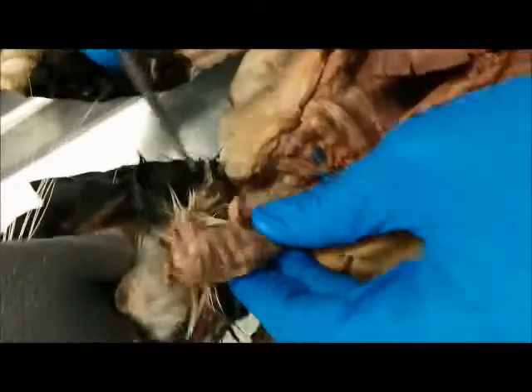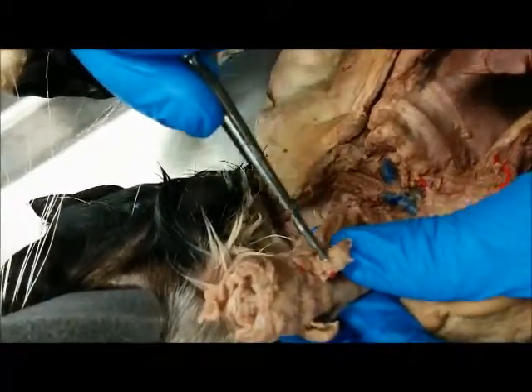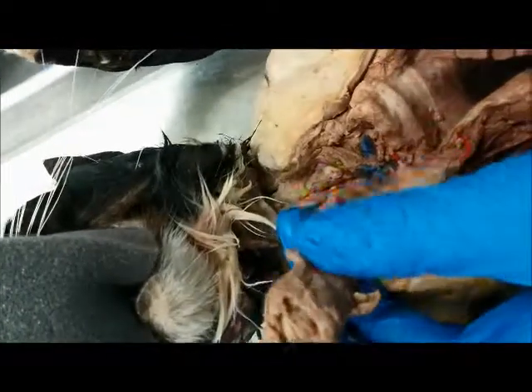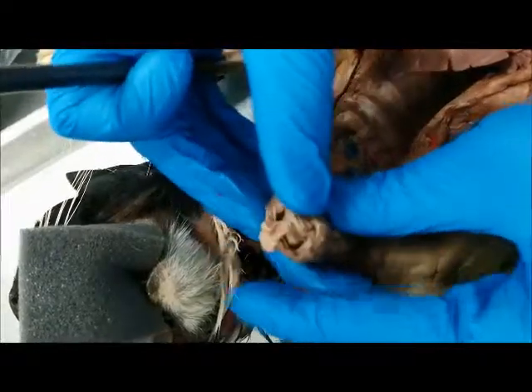And so now we're also going to take a look at the thyroid. So the thyroid, you have right here, you have one, and you have two. These little flaps right here represent the thyroids. And now let's actually take a look at where the trachea originates and everything else.